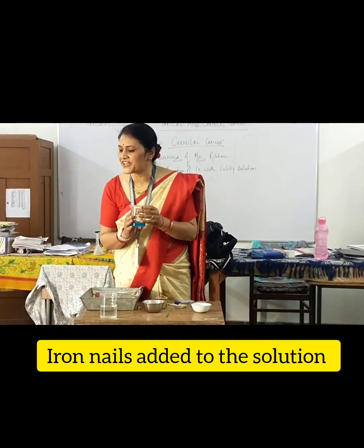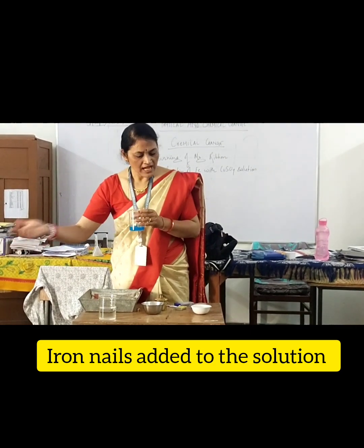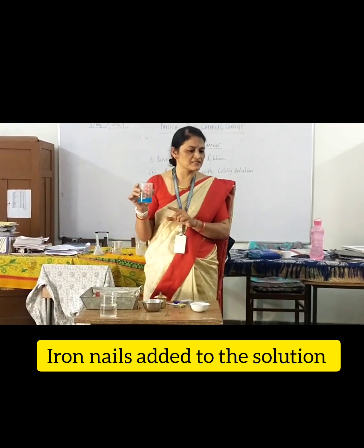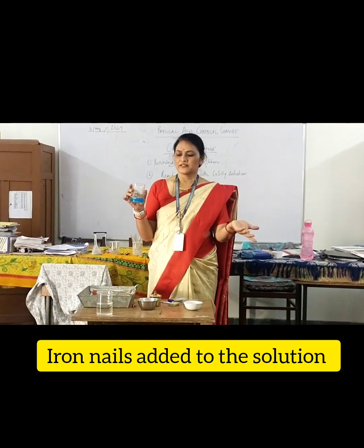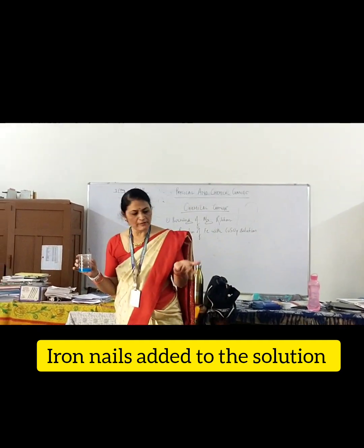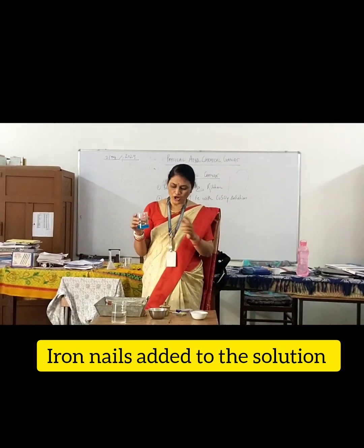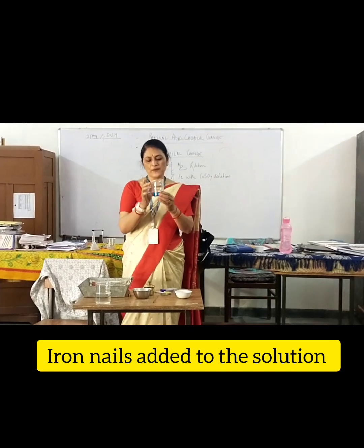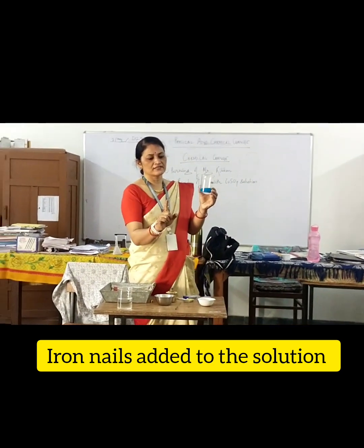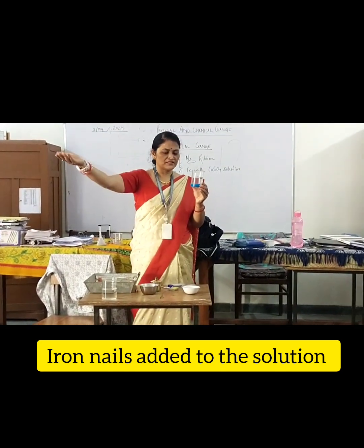Now we will see the change next week. I will bring this in class, because next week we will not be doing the activity here — that will be a normal class. So: copper sulfate plus iron. We will see the change in colour next week.